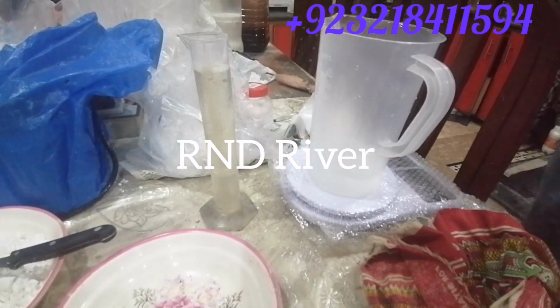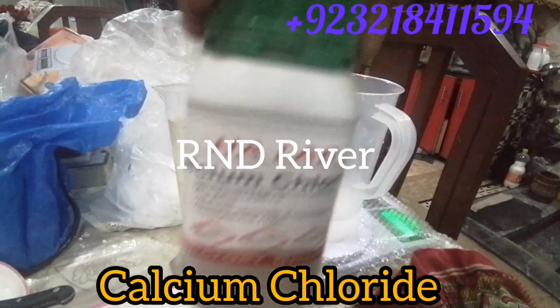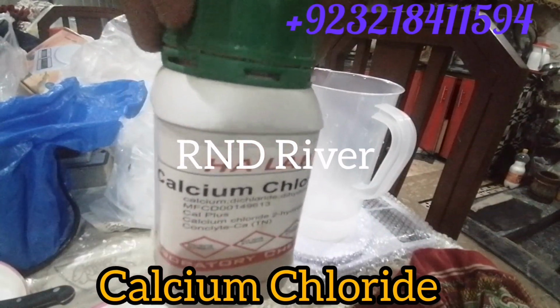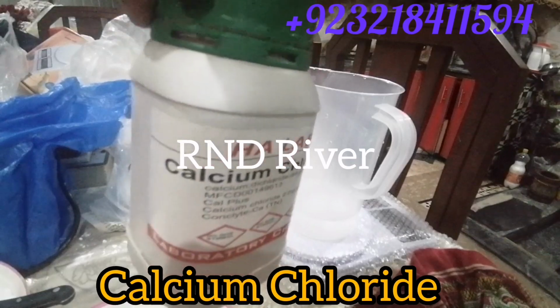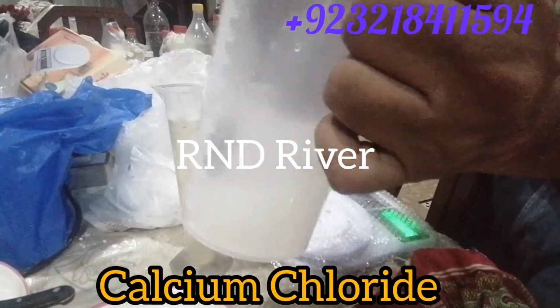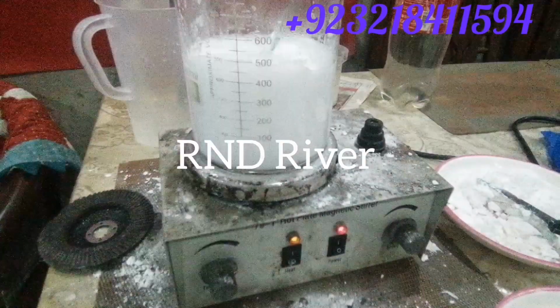Now we have to dissolve calcium chloride. This is calcium chloride. For making calcium stearate, calcium chloride and sodium stearate are necessary. The reaction of both items makes calcium stearate. Now look, this is the sodium stearate going into reaction.